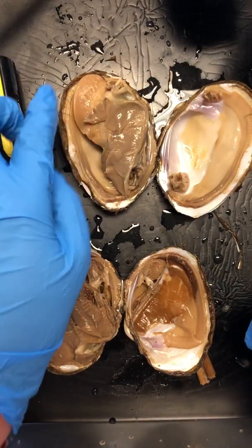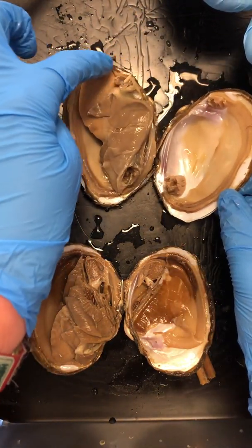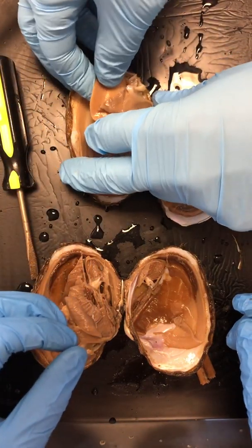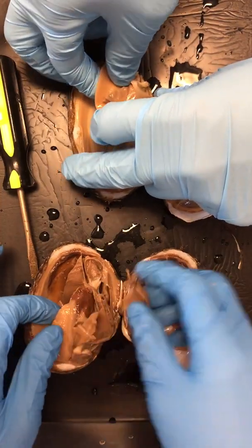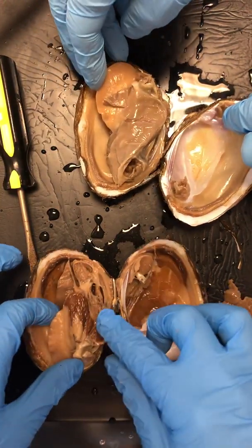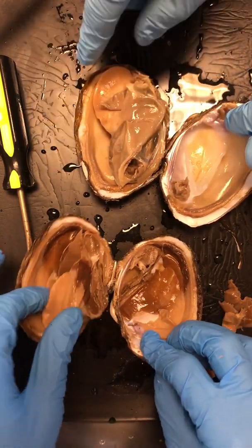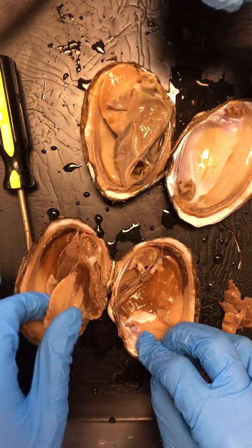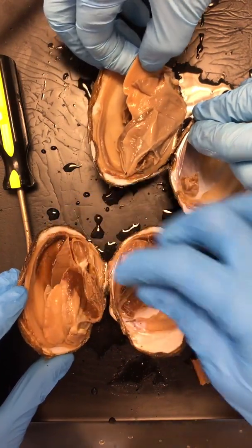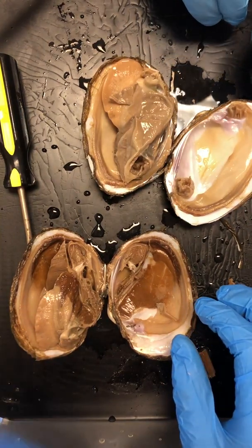So we're going to use that foot mostly for movement. It's this guy right here. It's a hard piece. It's really big, actually. It goes all the way from here to here. Coach, you want to push on that and tell me what it feels like? It feels pretty tough. Yeah, it's not squishy at all, right? Especially if you compare it to your other visceral mass pieces, like this top layer, which is pretty squishy. This foot is really hard, like a dried out piece of chicken. Pretty firm, because that's a really strong muscle. That foot needs to be nice and tough so that it can propel your mussel through the water. It's used a lot for digging, getting locked into place, which is kind of cool.